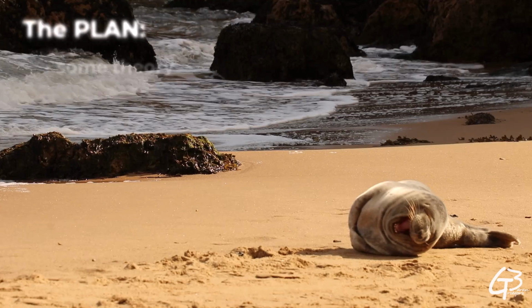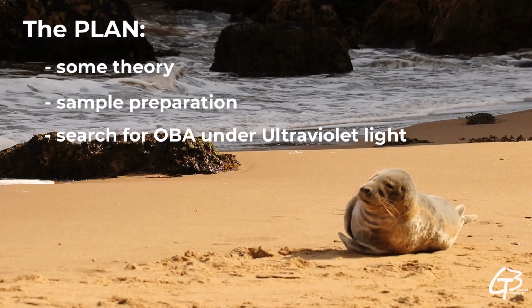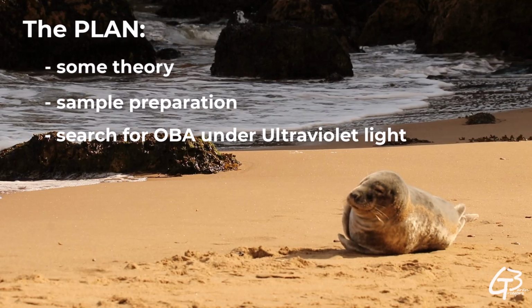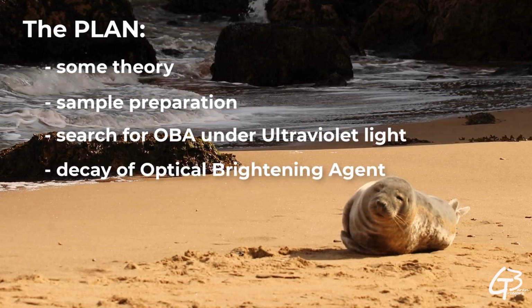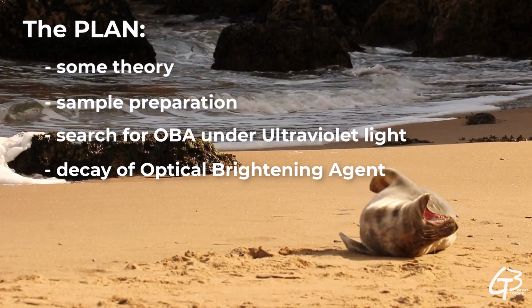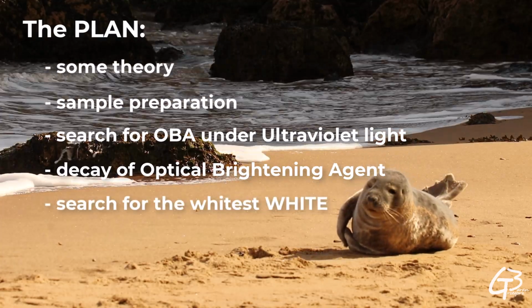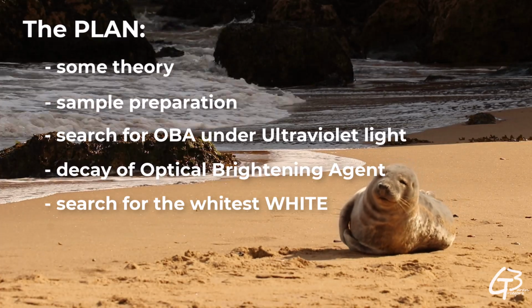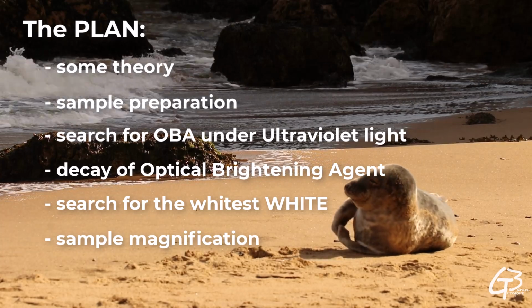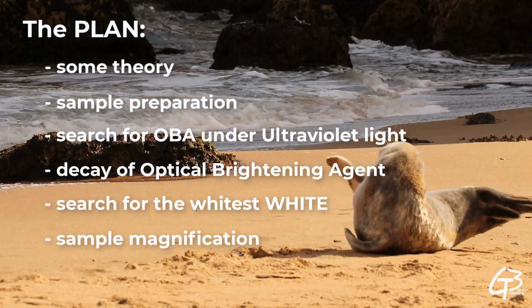This is the plan for this video. Get some samples and check them all under ultraviolet light to see how much of optical brightening agent was used to make them look brighter. Find out what actually happens to the substance which contains an OBA agent if left exposed to the daylight for a couple of months. Measure and compare all samples together to find the whitest white, as well as analyze the surface structure of each to better understand their light response by observing them illuminated by incident light under 20 times magnification.